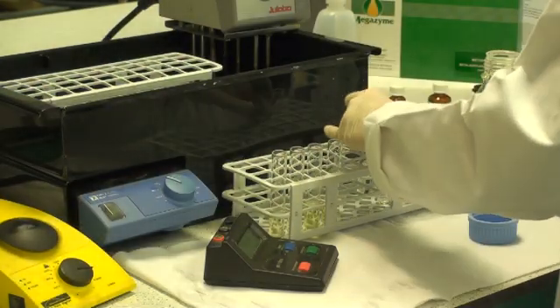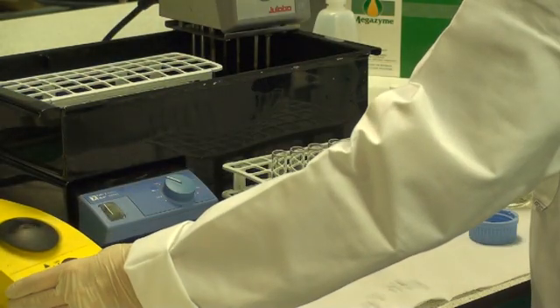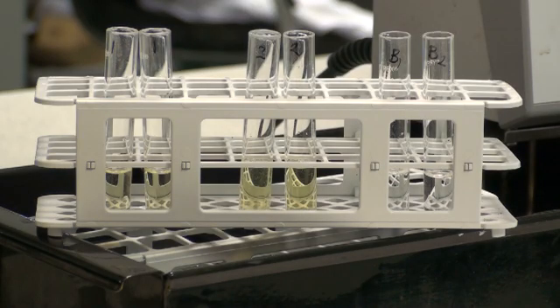With this sequence of additions, no reaction will occur. Addition of the alkaline stopping reagent both stops the reaction and develops the phenolate color. You can see the color in the tubes here for sample 1, sample 2, and for the blank. Only one sample blank needs to be performed for each set of determinations. These colors are measured at 400 nanometers.